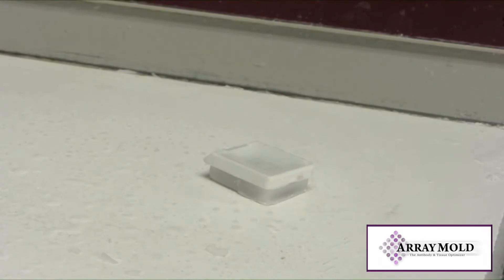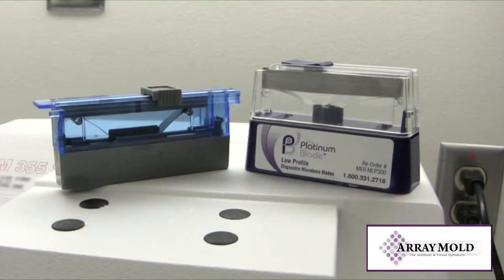Trim your edges and you are ready to cut. I'm not going to cover cutting procedures because there are as many techniques as there are histologists.